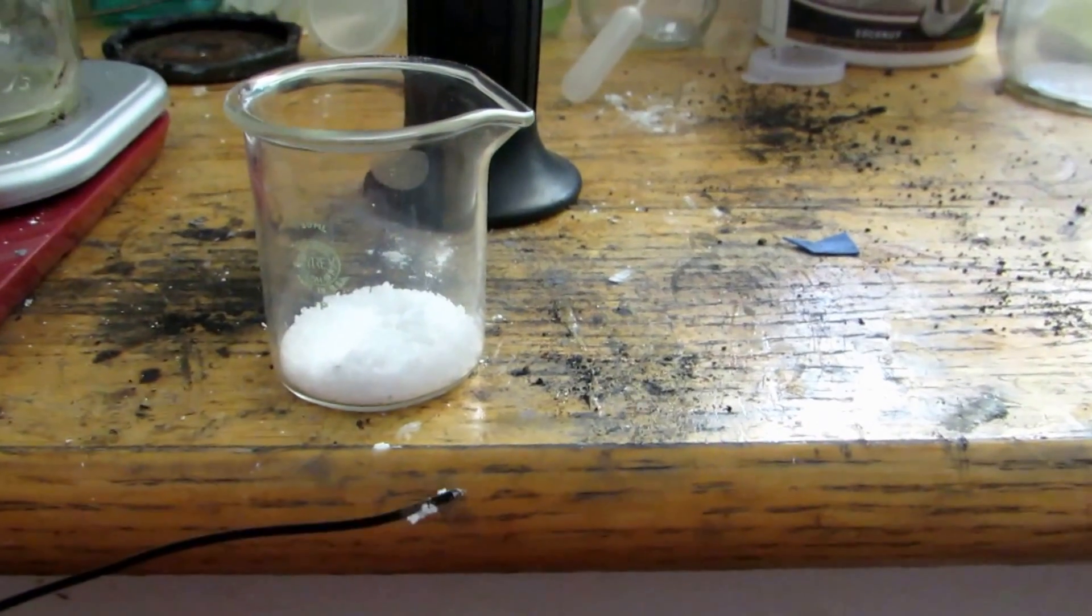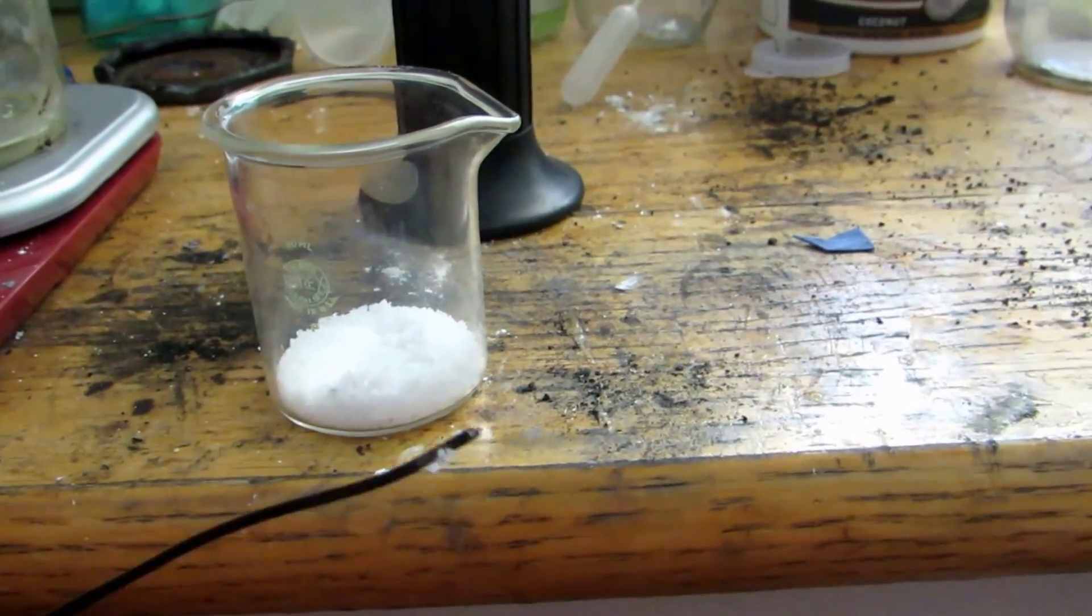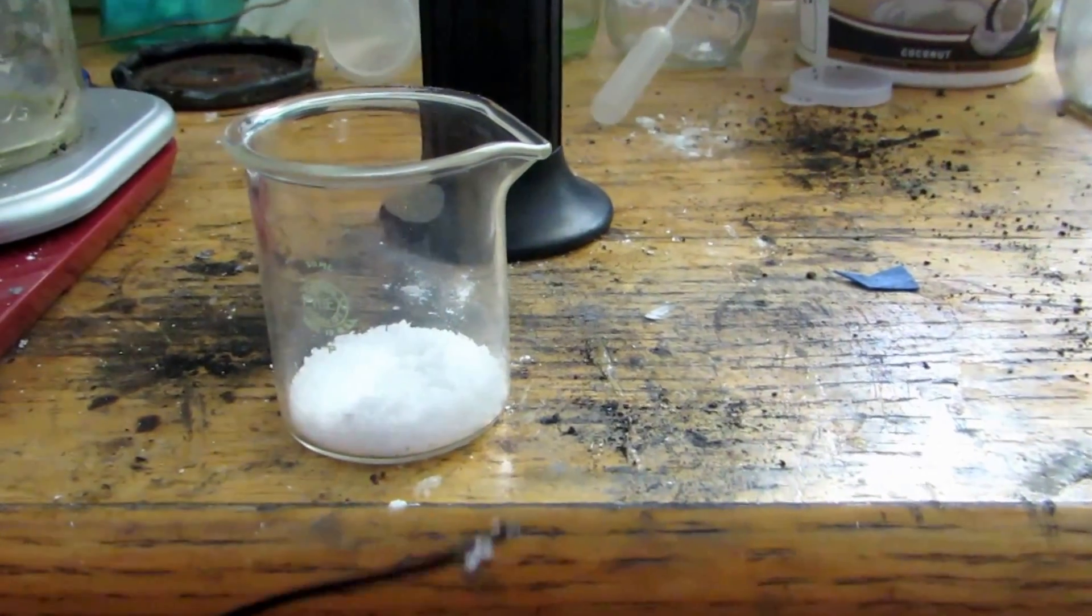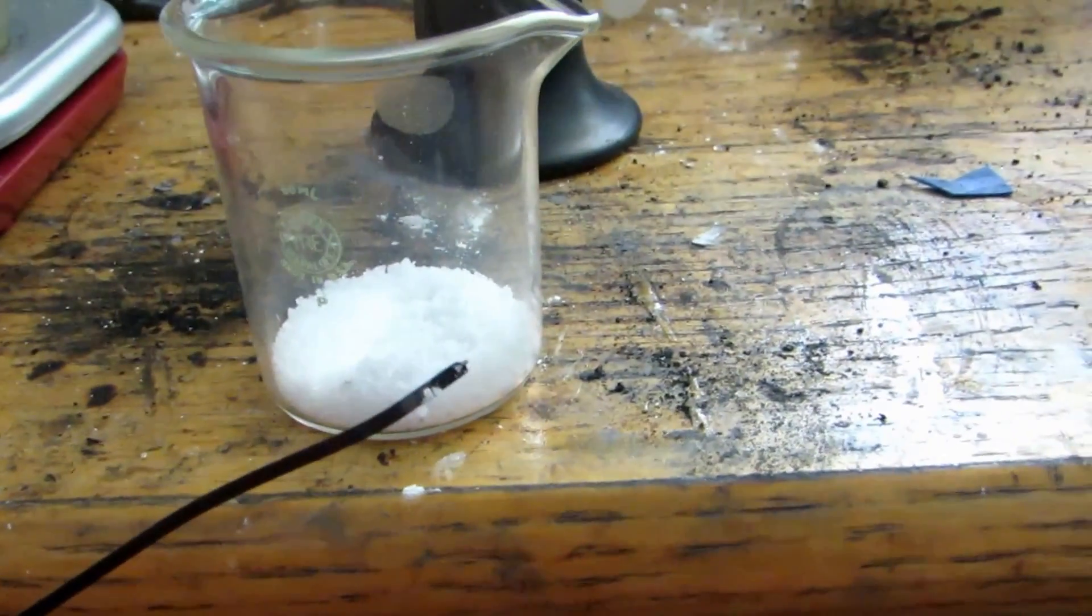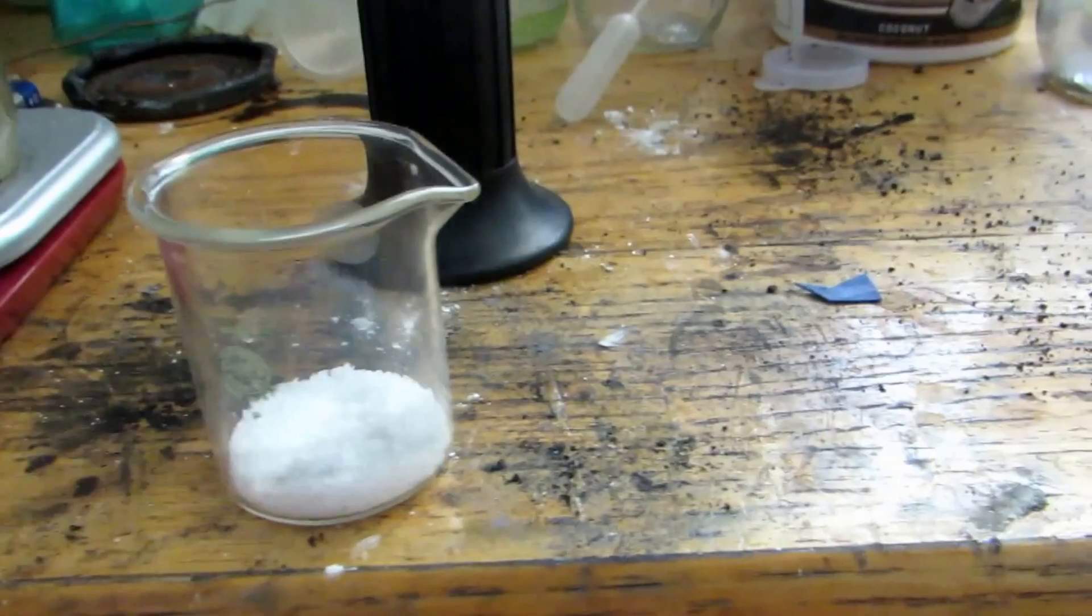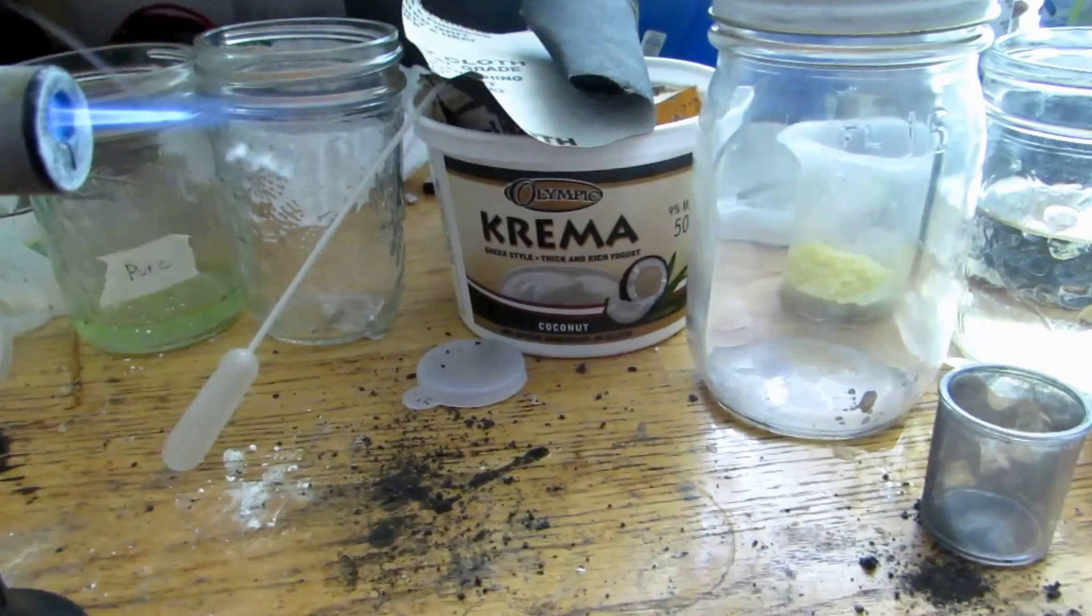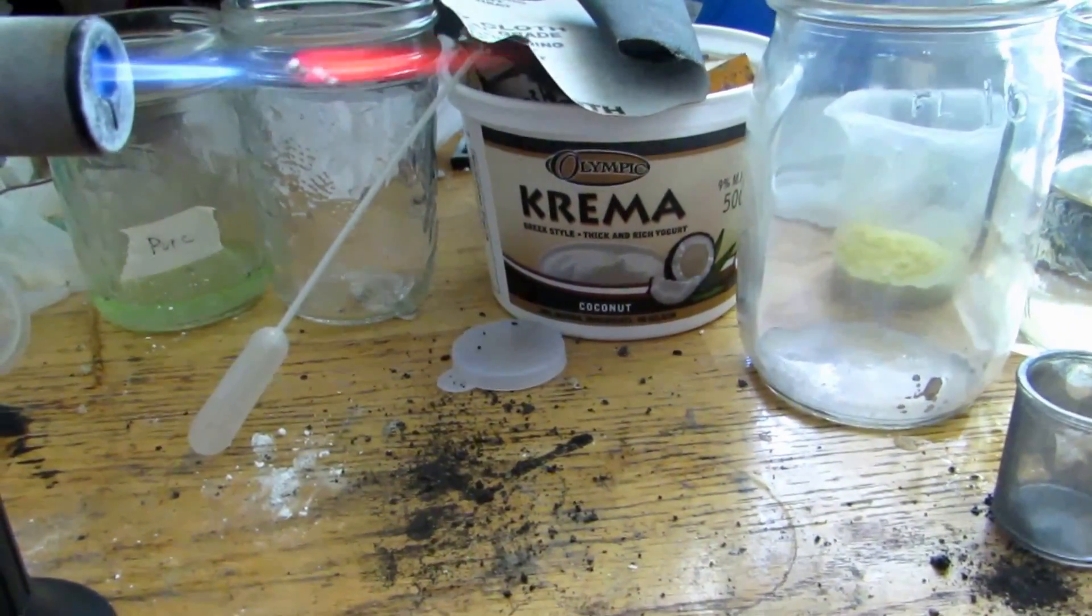Okay, so I discarded the potassium nitrate just because it's probably impure with other things that were used in the fireworks, but here's what's fairly pure strontium chloride, and I'm hoping it's going to work for this application. So we don't have a whole huge amount, but we still have a fair bit, and it did cost a lot more than you would commercially get it for.